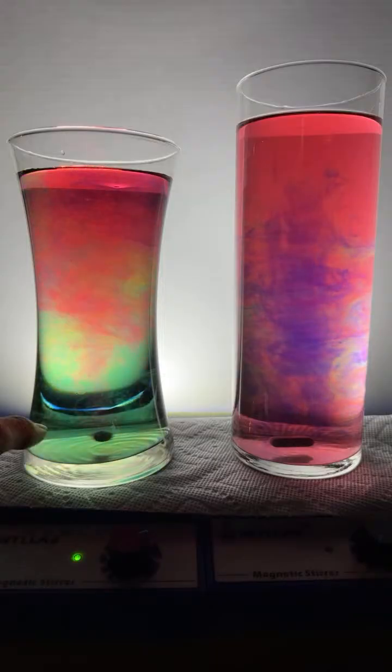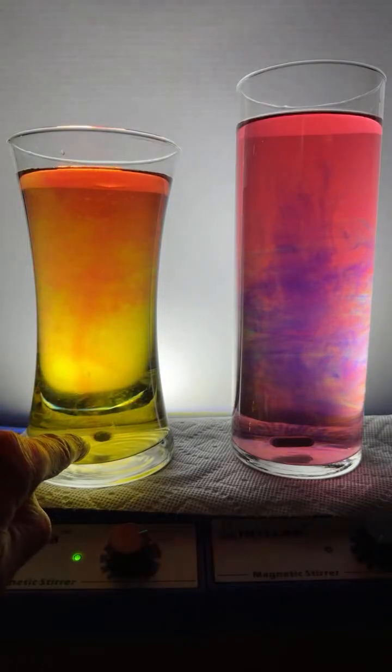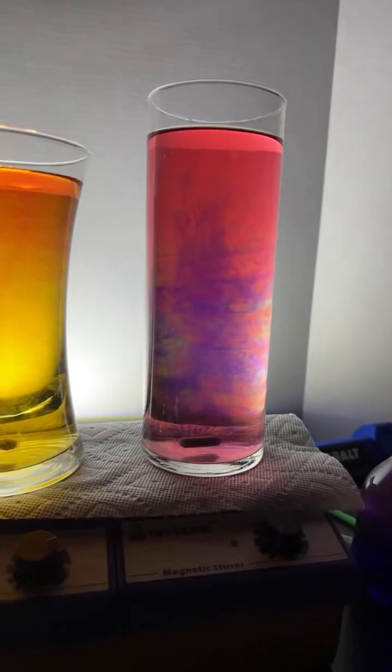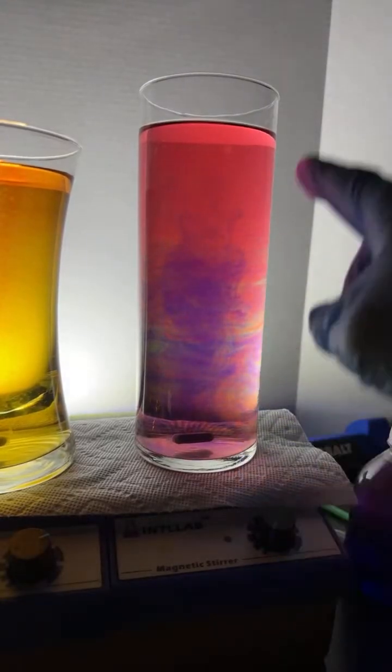How's the water spinning? There's a magnetic stir plate that it's sitting on, and then there's a magnetic stir bar inside the flask. This one over here, I just got it setting. This one's static, so this one's not spinning at all. I'm going to add another drop of base over here. We may get some cool stuff happening here. I'm going to see if we can get the pH gradient going over here.